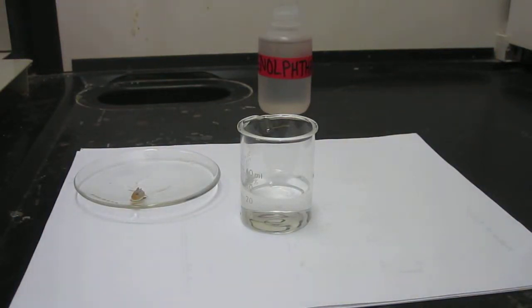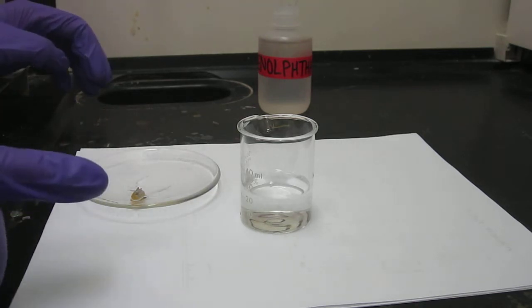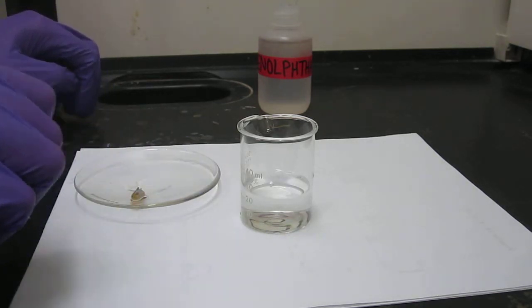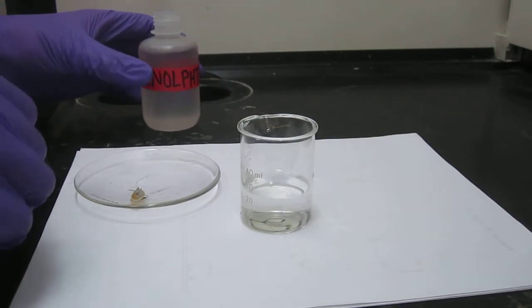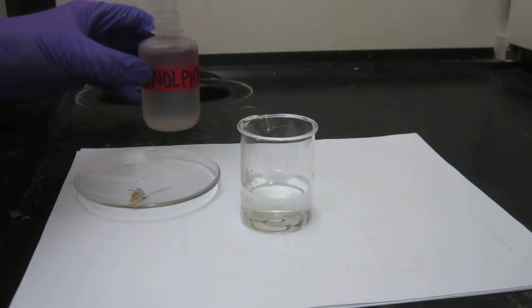Okay, so let's try this experiment. We got it in the hood right now and hopefully you can see we've got a 50ml beaker half full of water and we're going to put a couple of drops of phenolphthalein in there.